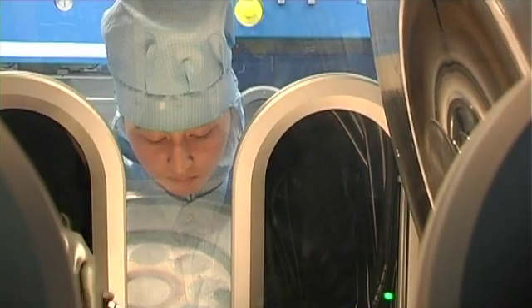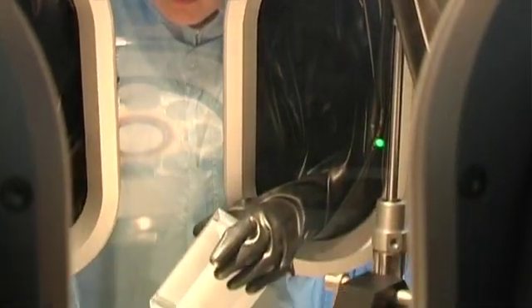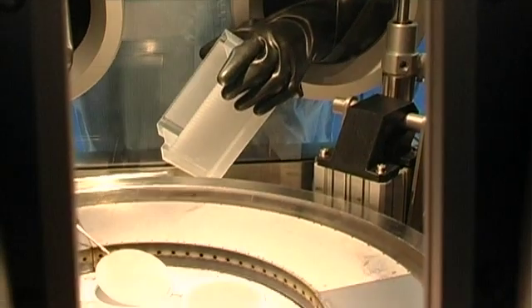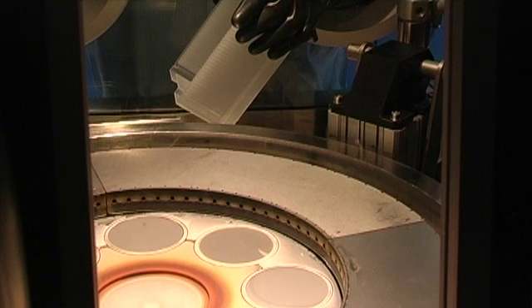Here you see how the 3-inch sapphire substrates are loaded into the reactor. With the EPI-CURVE, we get individual data for each wafer, allowing us to monitor wafer uniformity and wafer-to-wafer variations in situ.